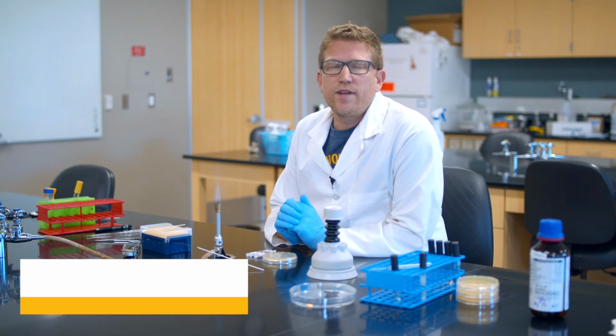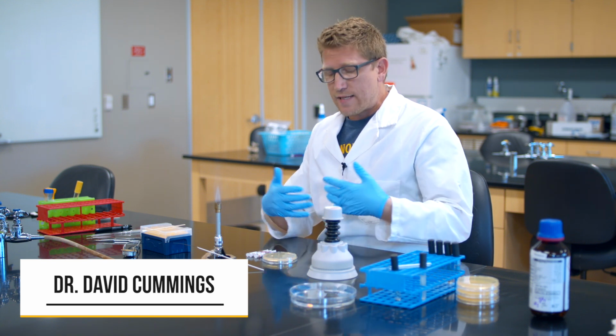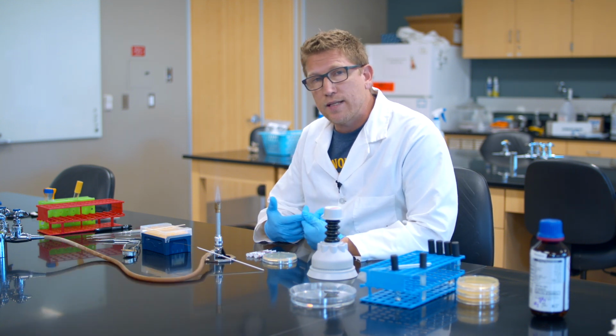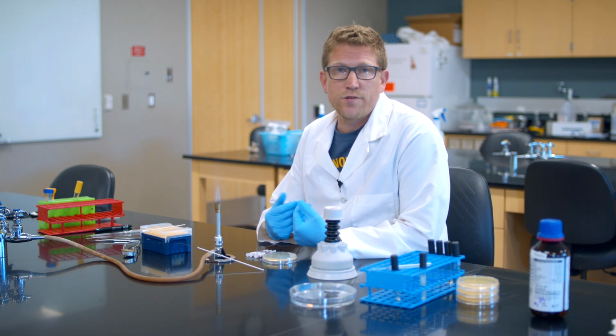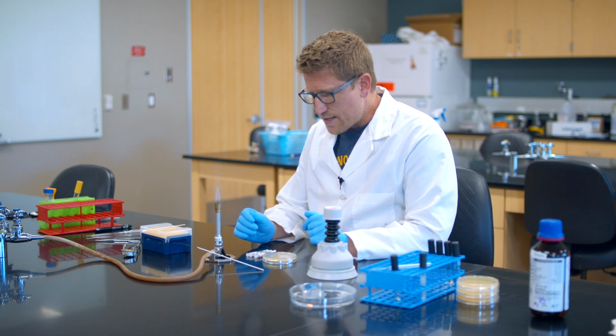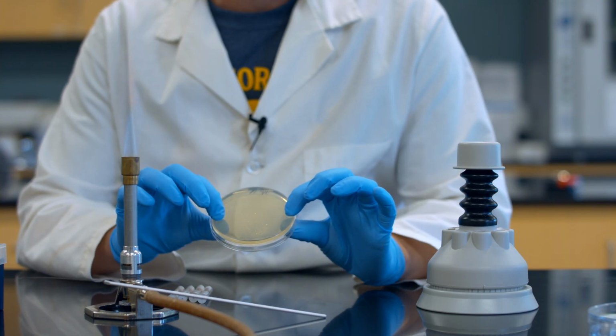Hey guys, so in this video I want to teach you how to create what's called an antibiogram. This is antibiotic disk susceptibility testing. Some of the textbooks like to call this the Kirby-Bauer Disk Diffusion method in honor of the two scientists that developed this method. So what I have is an agar petri dish, right?